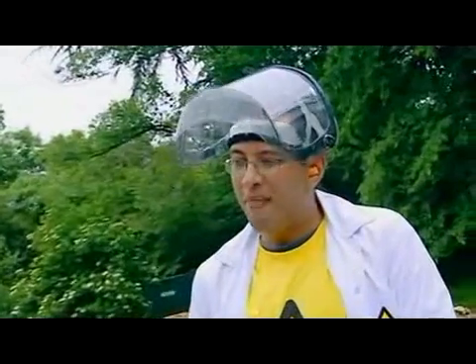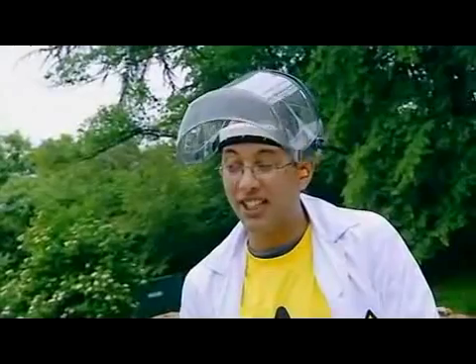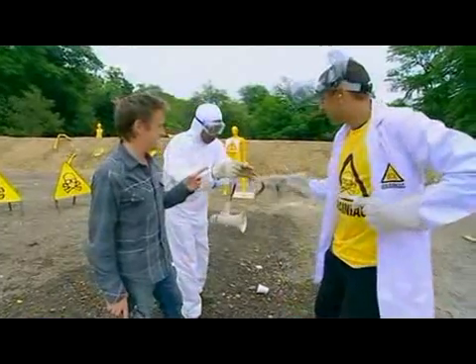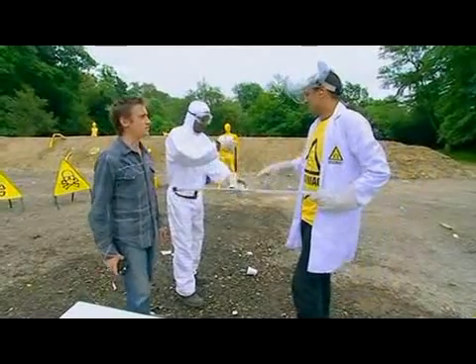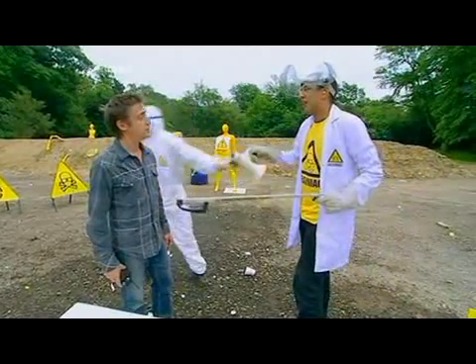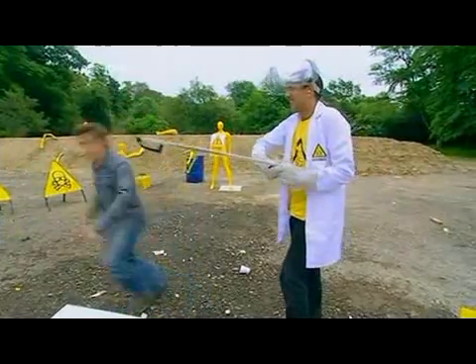Yes, Richard, cesium, the emperor of alkali metals, particularly nasty, could go off at any time. And that's it? Oh, yes. Brilliant. I like it already. Now, what's that going to do when it hits the water? Imagine a depth charge in a bathtub. Fair enough, mate. I'll leave you to it. Good luck. Thank you.